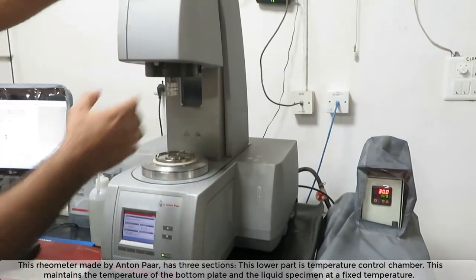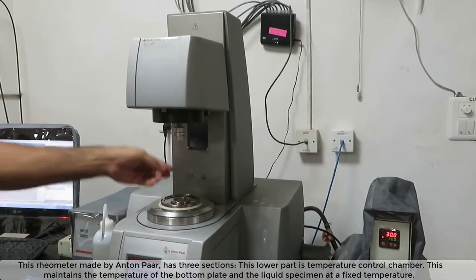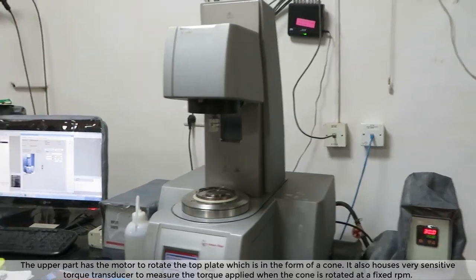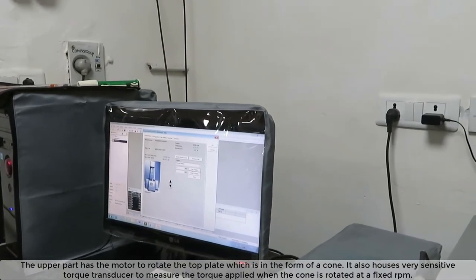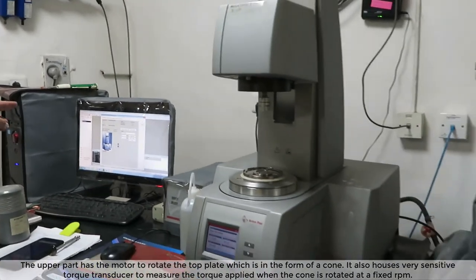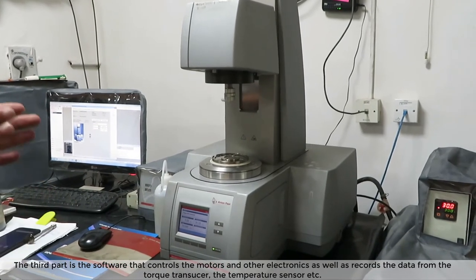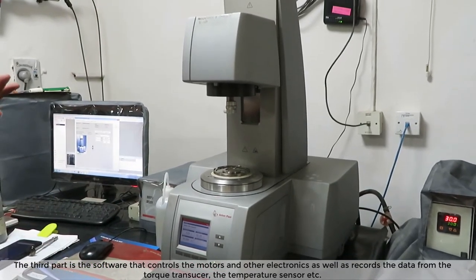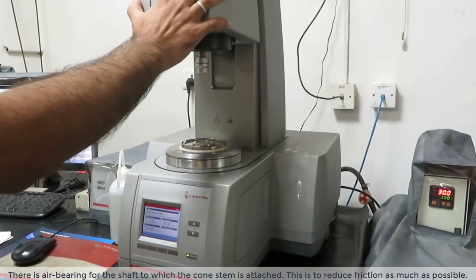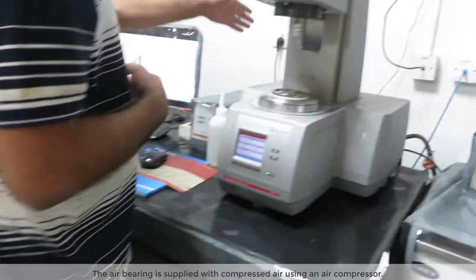This rheometer has three sections. The lower part is a temperature control chamber that maintains the temperature of the bottom plate and liquid specimen at a fixed temperature. The upper part has a motor to rotate the top cone plate, and also houses a very sensitive torque transducer to measure the torque applied when the cone is rotated at a fixed RPM. The third part is the software that controls the motors and electronics, and records data from the torque transducer, temperature sensor, etc. There is also an air bearing for the shaft to reduce friction, supplied with compressed air from a compressor.